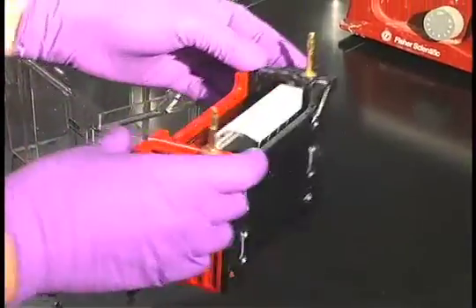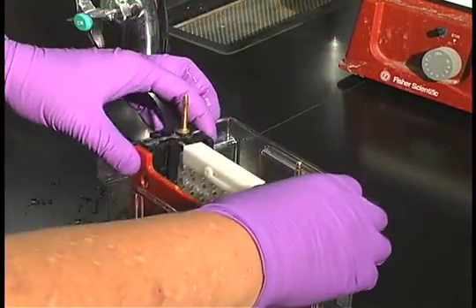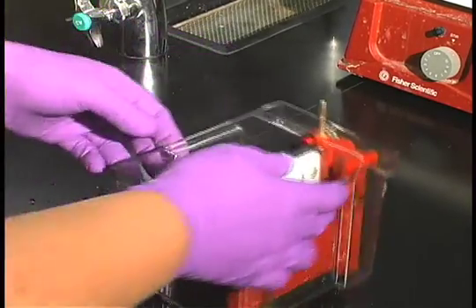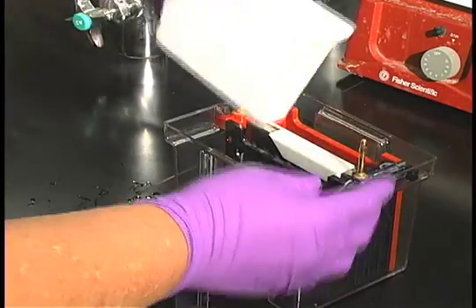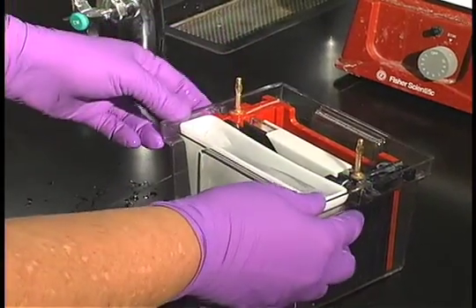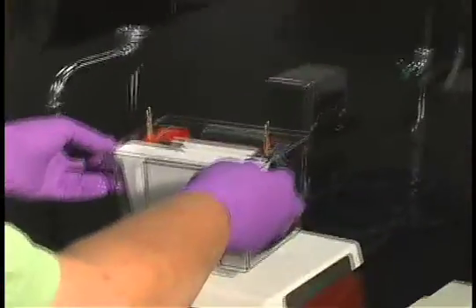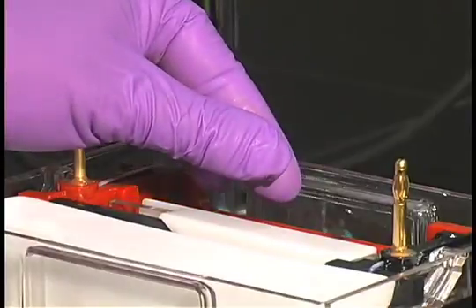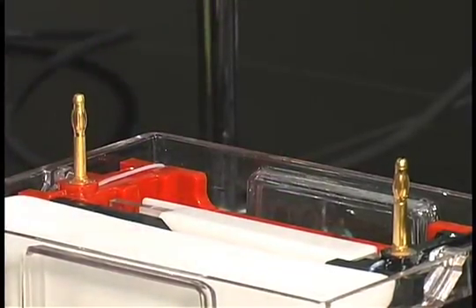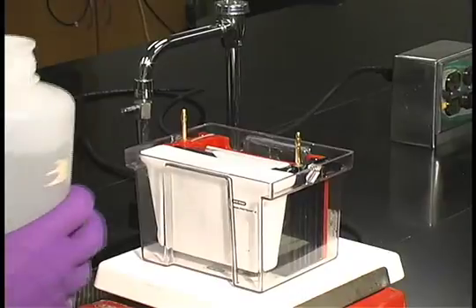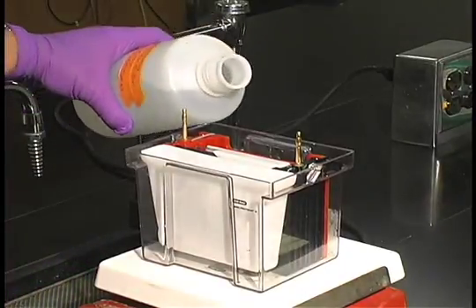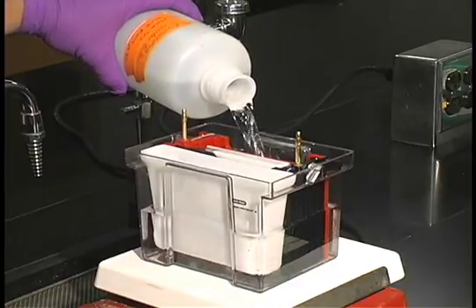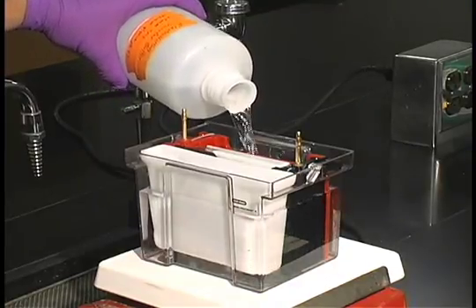Now we're ready to put this cartridge into our tank. Make sure that the leads are in the middle. Then we'll put an ice container in here. This is to keep the electrophoresis buffer cool during the electrophoresis. Put that on a stir plate and drop in a stir bar. And we'll fill the tank with our electroblotting buffer. Make sure the tank is filled all the way to the top so we get good electro transfer.